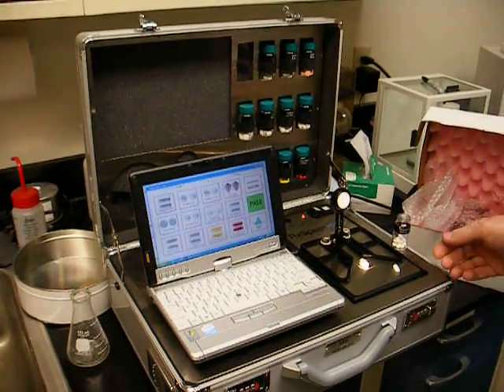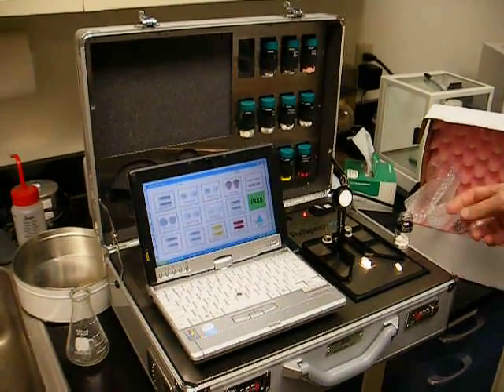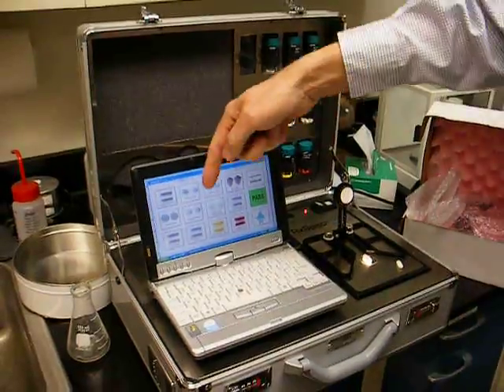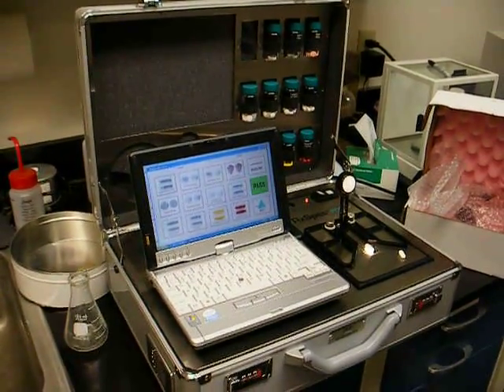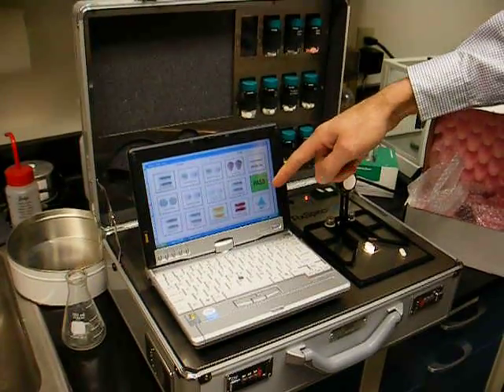The RX-700Z can be used to identify drugs simply by tapping on the icon representing that product. There we see an indication that it's passed.